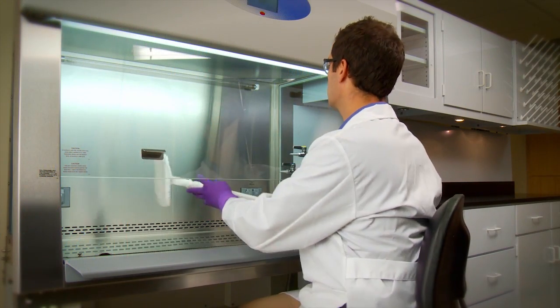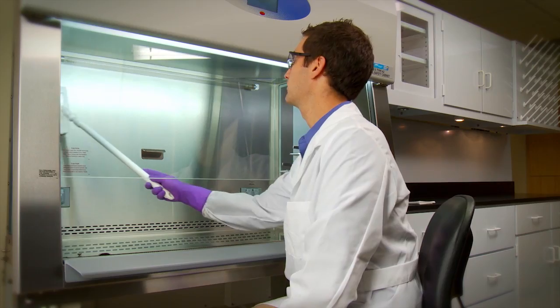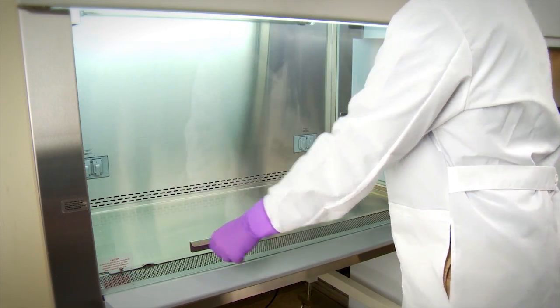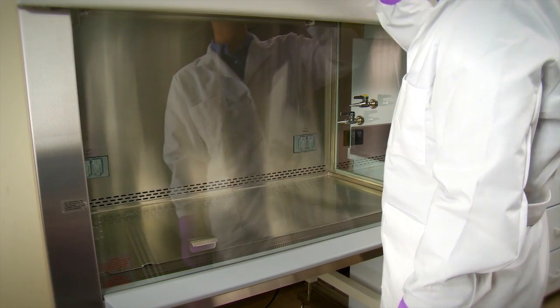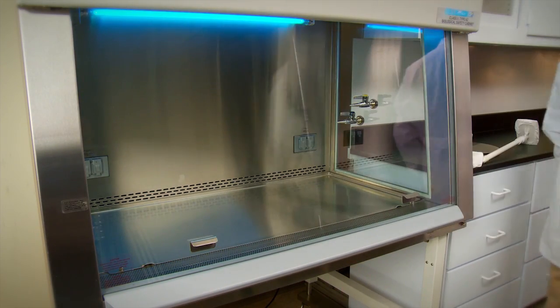Make sure the work surface, interior walls, and surface of the window are disinfected. Also, the ultraviolet germicidal lamp is an important ally but should not be solely relied on to provide a clean and disinfected work area.